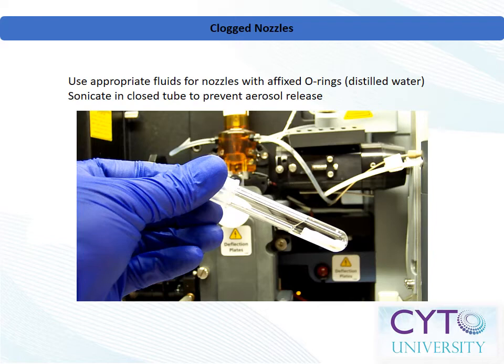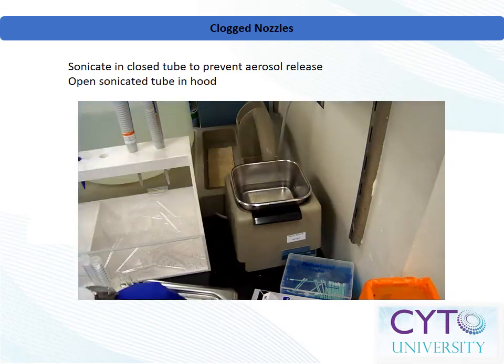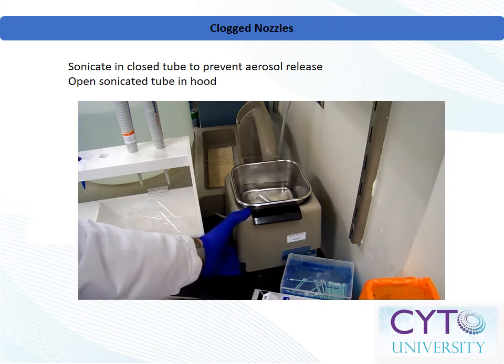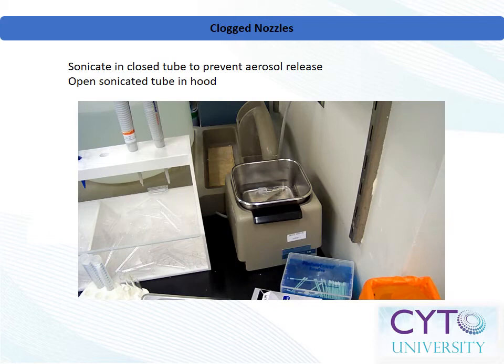For certain nozzles which have affixed O-rings, it is important not to use any detergents or harsh cleansers which may dissolve the nozzle's O-ring adhesive. Cap the tube and place the entire tube into a water bath sonicator. Run the sonicator for 30 seconds or longer to dissolve the clog. Remove the tube and nozzle from the water bath sonicator, and again, follow standard operating procedure before opening the tube in order to avoid exposure to aerosols created during sonication. Drain the water and nozzle onto a lint-free absorbent wiper, inspect the nozzle's O-ring, reinsert the nozzle, and check and adjust the stream as needed.